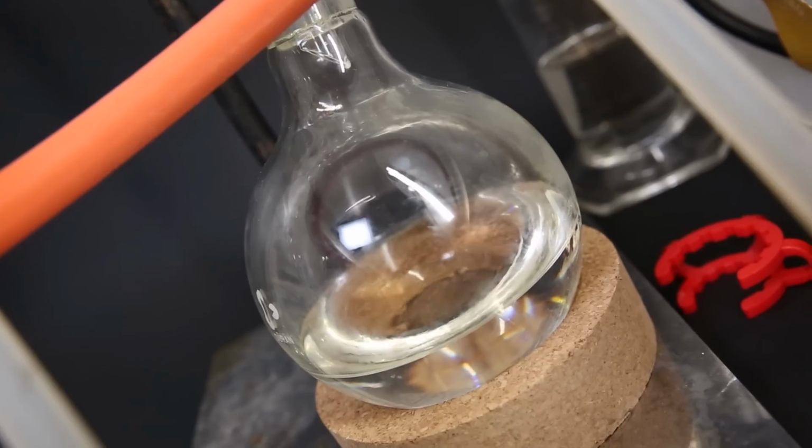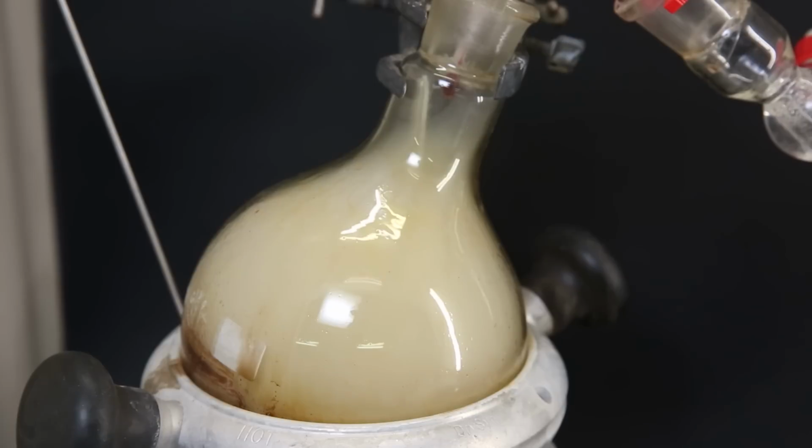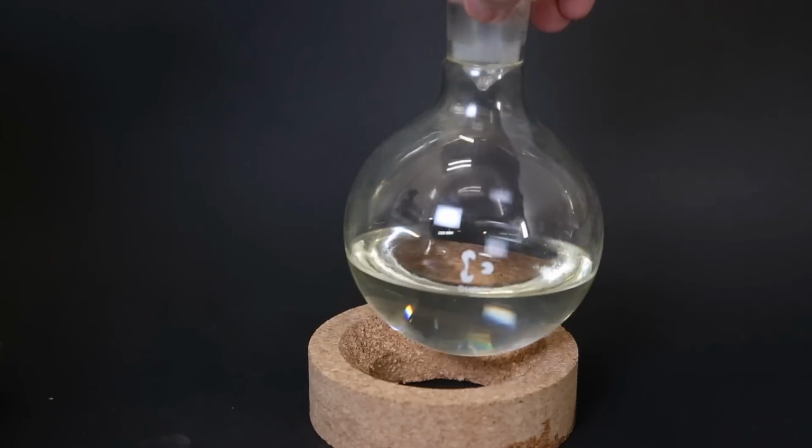So I stopped the vacuum distillation and let the air back in. Somehow the junk hadn't oxidized enough yet, and it started to form dense vapors in the flask. Anyhow, that goes straight to the garbage, and I'm left with a mixture that is mostly cyclohexanone and the enamine.